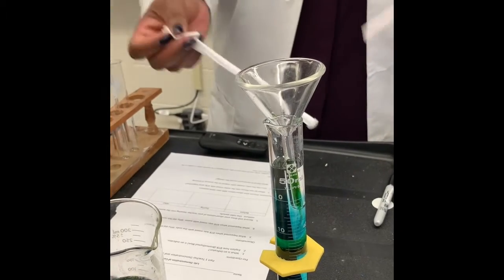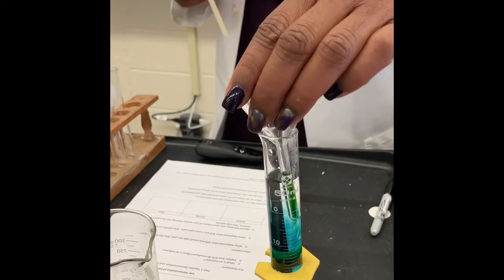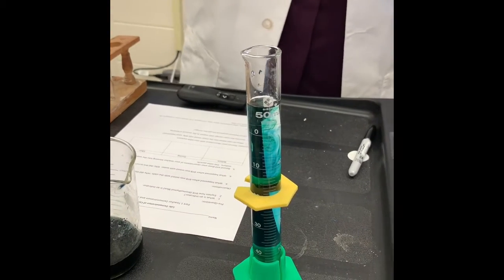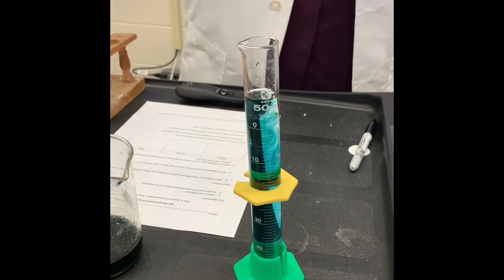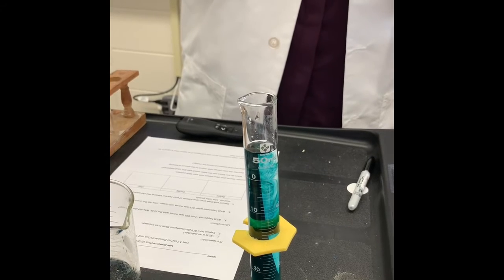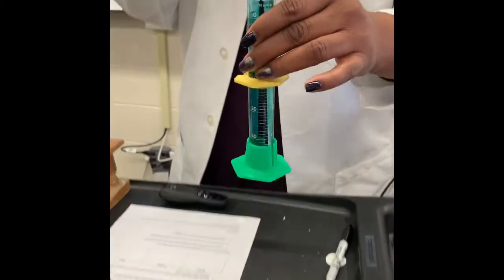So I have a straw. We took it out of the container so it's sanitized, and I'm going to take my funnel out, put it back over here. Now, I am not drinking this like you would in a regular drink or a milkshake, but I am going to breathe into it. And what's a good way to breathe into water? We do it all the time when you were a kid and you had milk. You would blow bubbles into your milk to see those giant bubbles come up. So now I'm going to blow bubbles into the water, and we're going to see if anything happens.